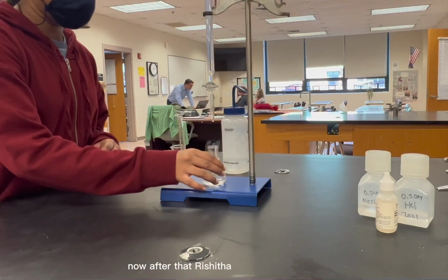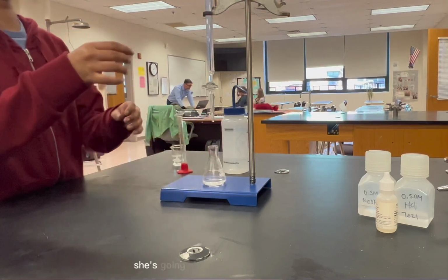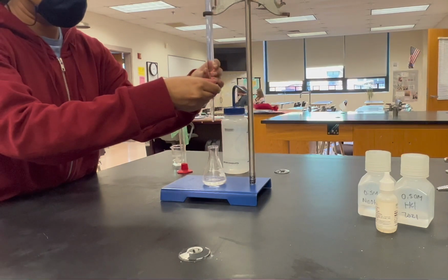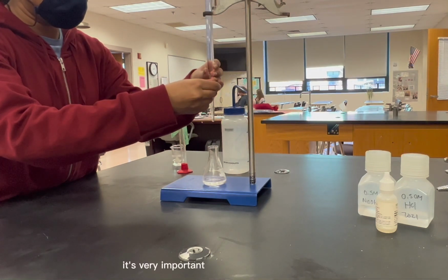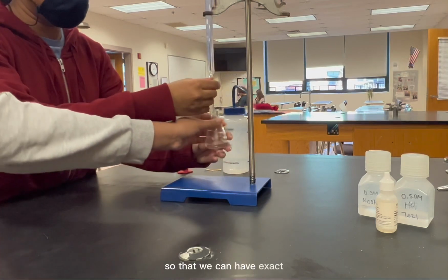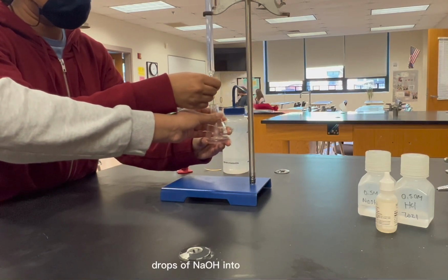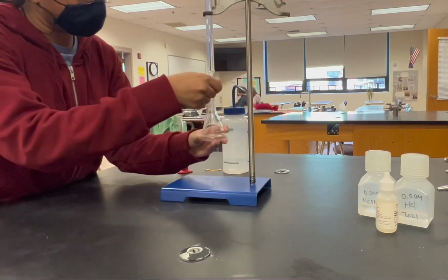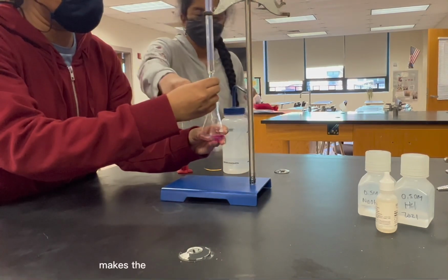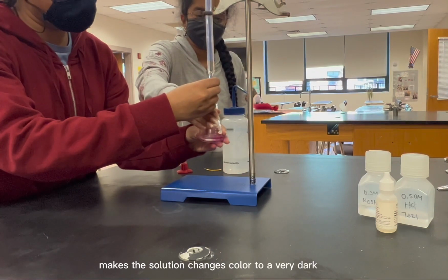Now after Rishitha mixed the solution, she's going to put it under the pre-filled NaOH graduated pipette. It's very important to open the pipette slowly so that we can have exact drops of NaOH into the solution. As you can see, NaOH makes the solution change its color to a very dark purple.